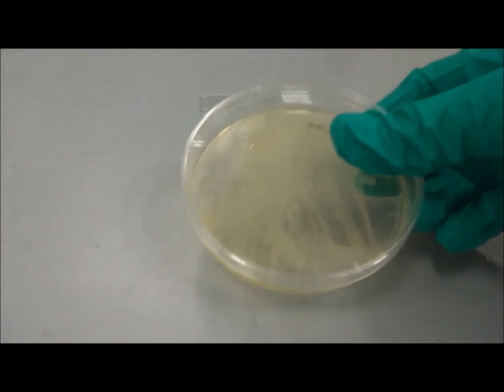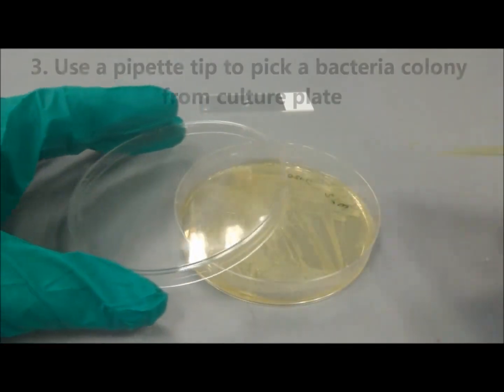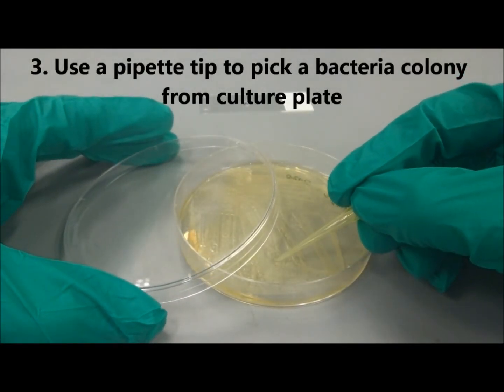Next, prepare your bacterial culture plate and use a clean pipette tip to pick up a single colony.